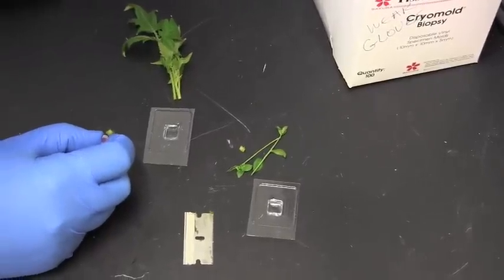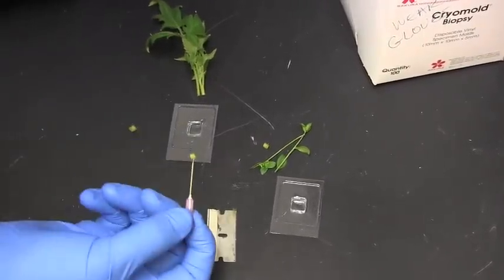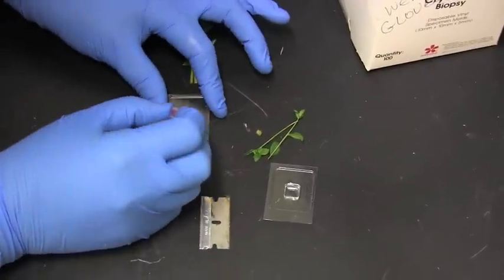You can use tweezers, but I use a really fine gauge needle in order to put it into the matrix.